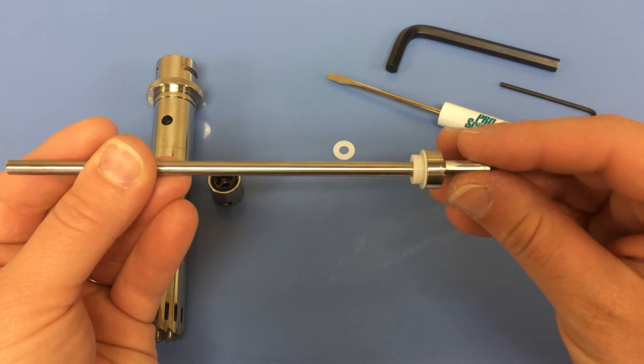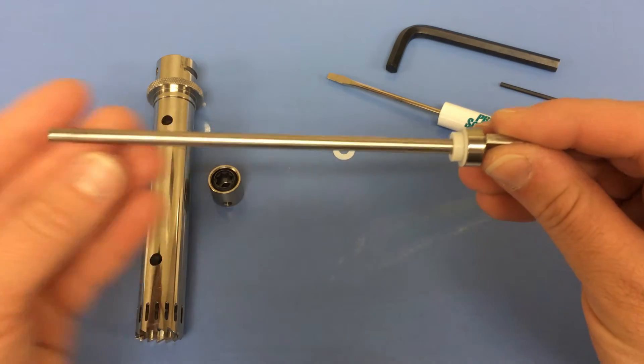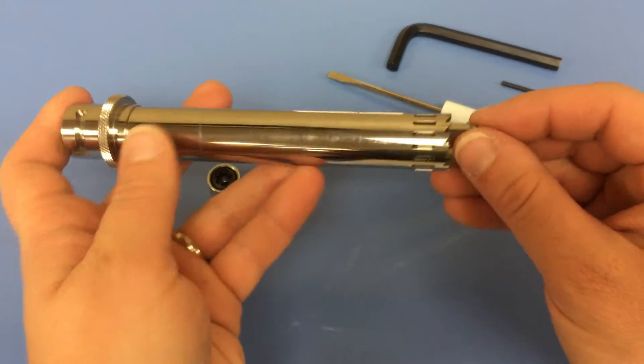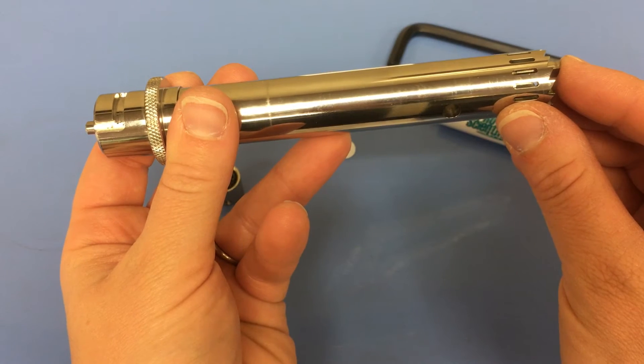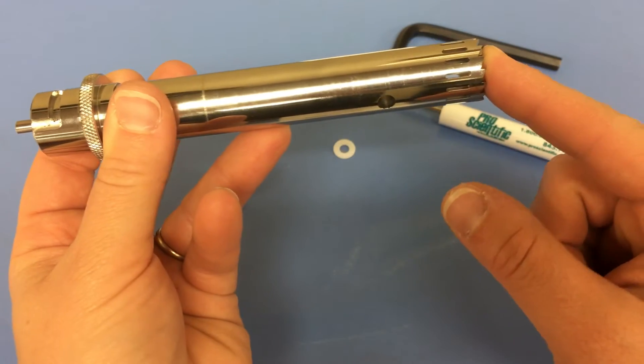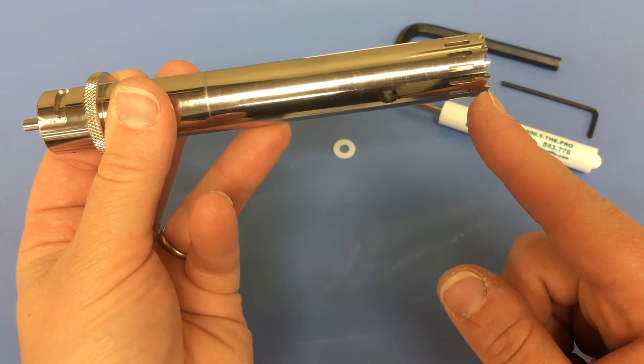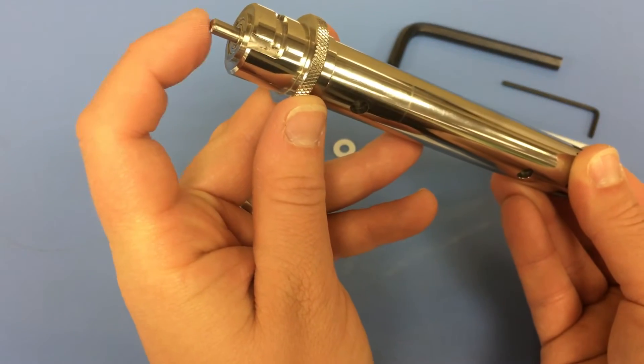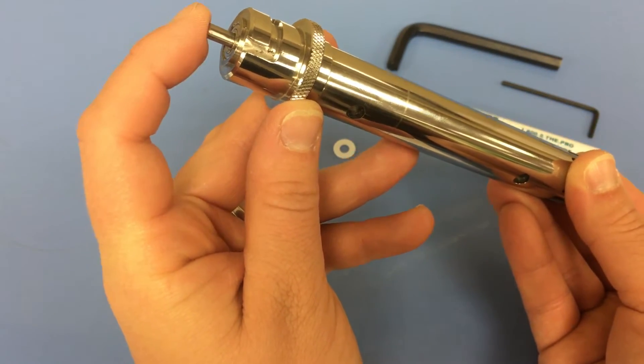Insert the rotor shaft into the end of the tube and collar assembly. Then push the rotor knife up into the tube and collar assembly until it cannot go any further. This will put the lower bearing into its proper place. The rotor shaft should stick out through the upper bearing located in the top of the tube and collar assembly.